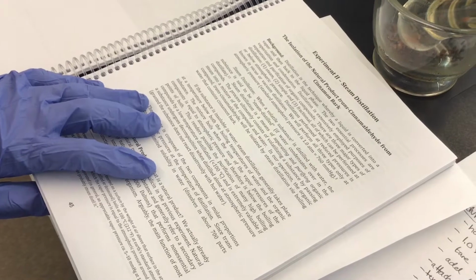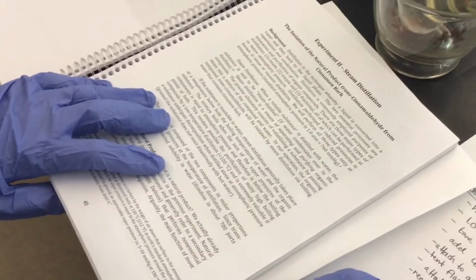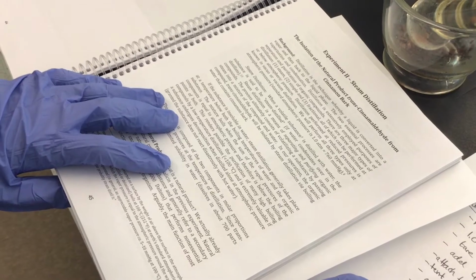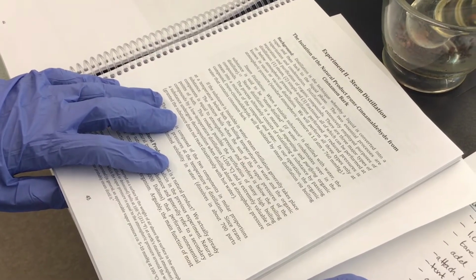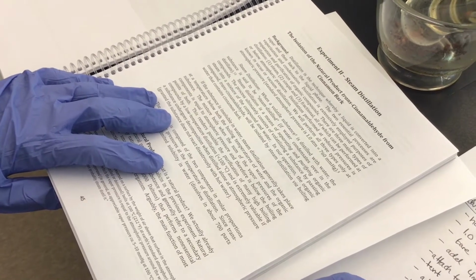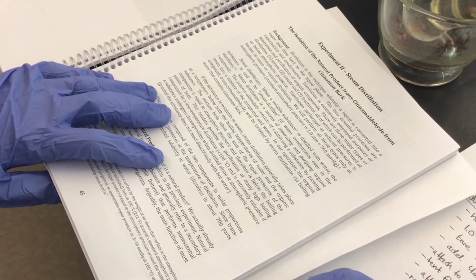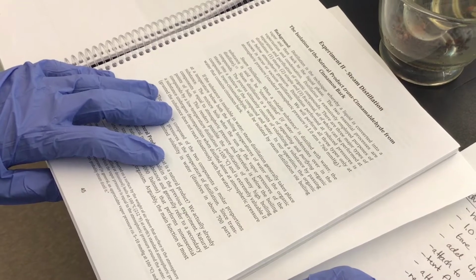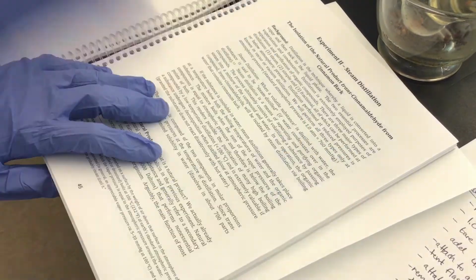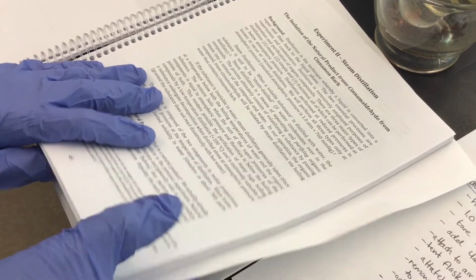We are going to start with steam distillation. The next experiment will talk about the simple and fractional distillation processes. And these distillations we perform at or below atmospheric pressure. Today we're going to do it at atmospheric pressure, but if it were performed at reduced pressure, that is to say if we used a vacuum, we wouldn't have to heat the liquid in the distillation pot as high, but here we don't care too much about that.